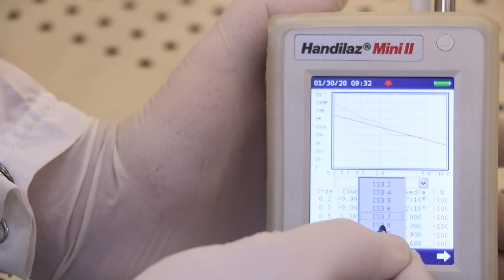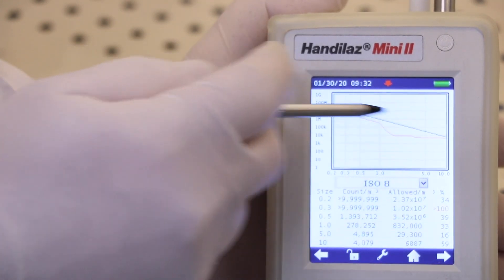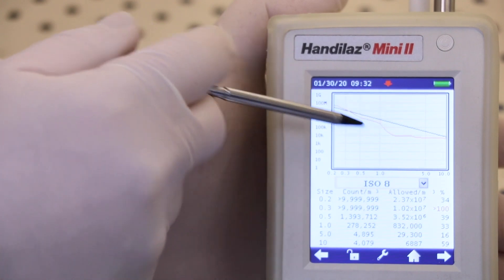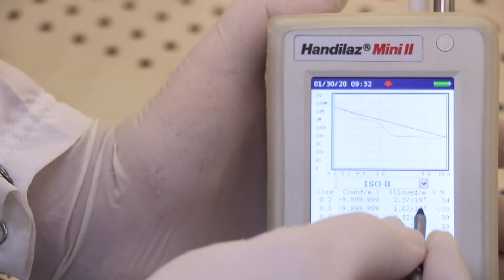Selecting ISO class 8 shows that we are much closer, but still fail at the lower end. So we have used this instrument to confirm that this environment is ISO class 9.